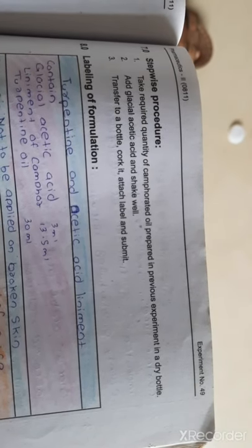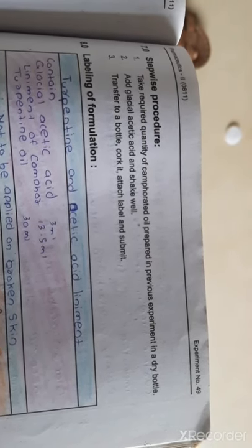The procedure involves only three steps. The required quantity of camphorated oil is prepared in the previous experiment. In a dry bottle, add glacial acetic acid and shake well. After that, cork it, attach the label, and submit the liniment.